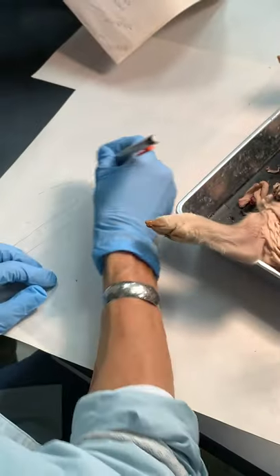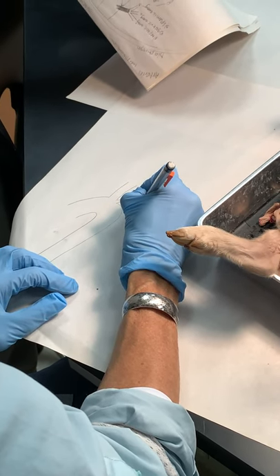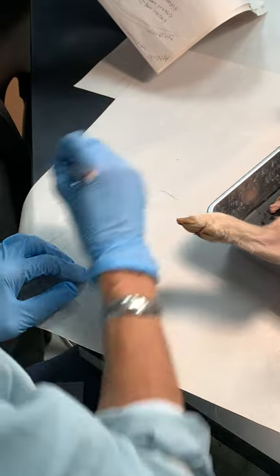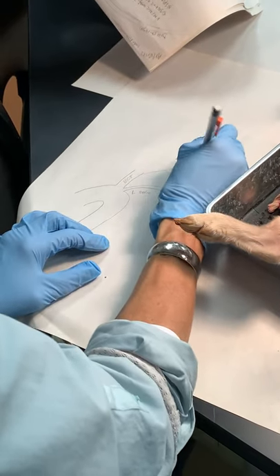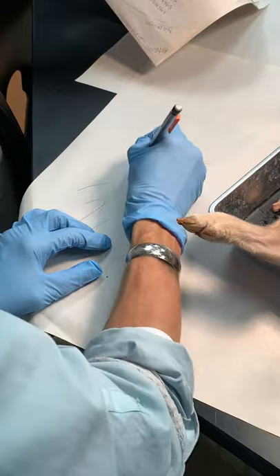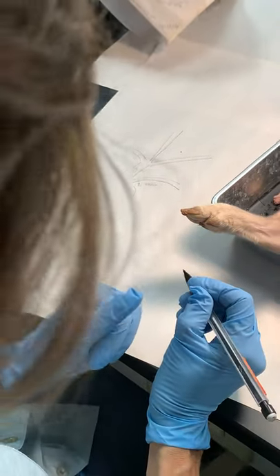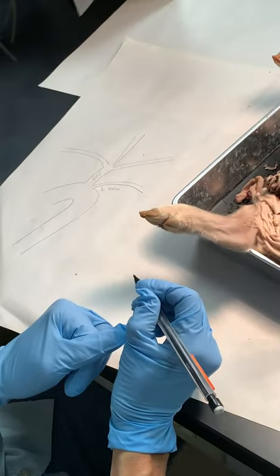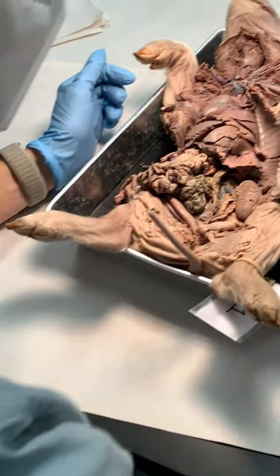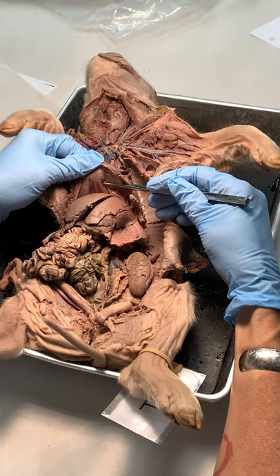So with this being the left subclavian and this being the brachiocephalic trunk, this will go to the carotids and then to the right subclavian. All right — let's do the arteries and veins below the diaphragm.